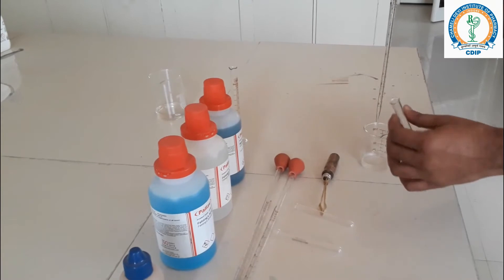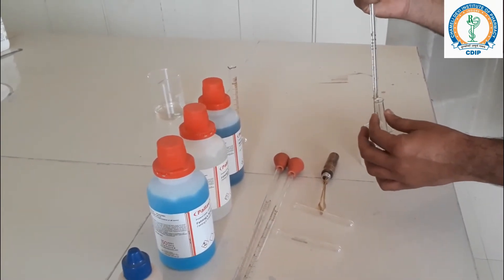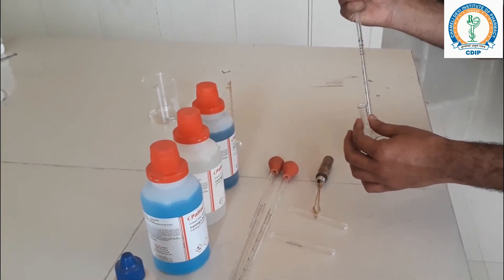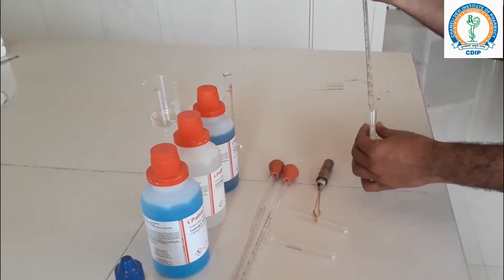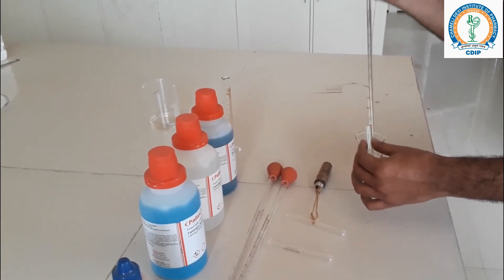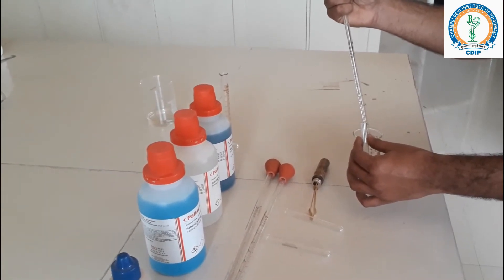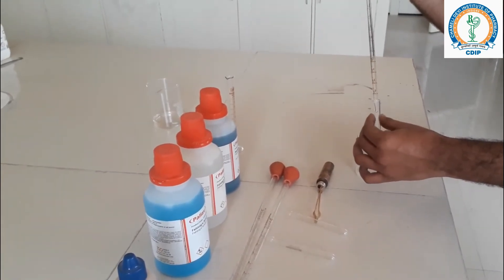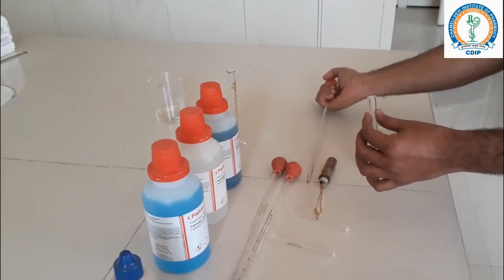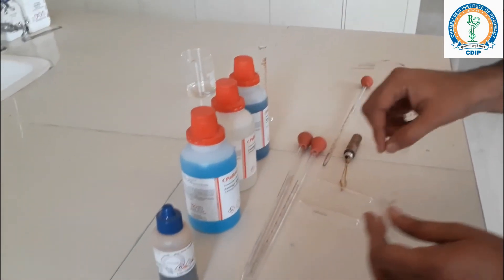First of all, we will add 2 ml of test solution in a test tube. And now, add 2 drops of Molisch reagent. Step 2.